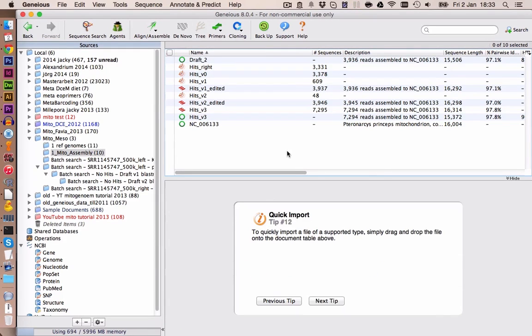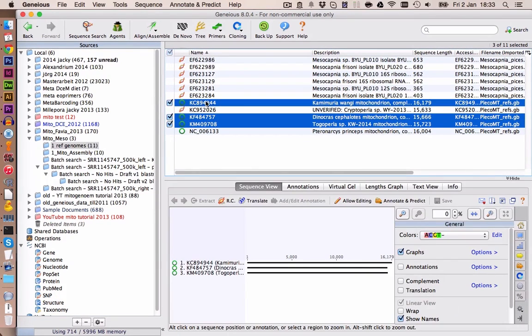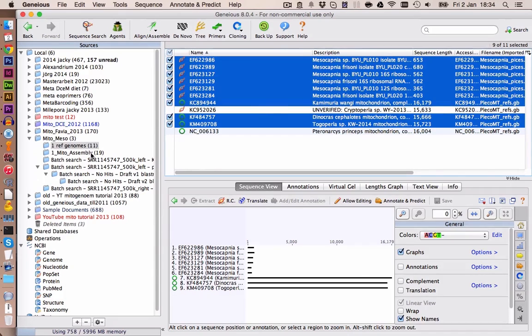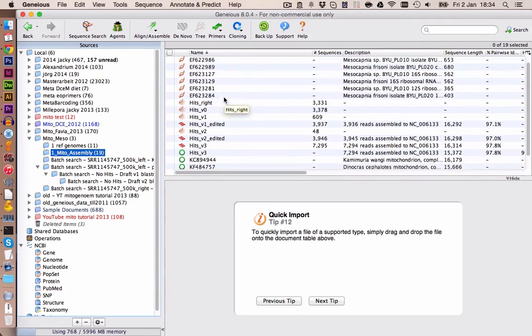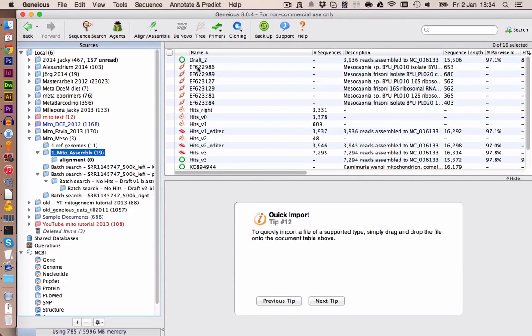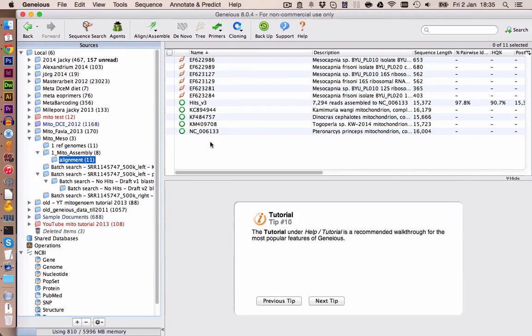So let's get some more reference genomes in here. And actually let's include also the Mesocapnia sequences. Let's maybe make a new folder. And we call it alignment, just to have things a bit more organized. This should be fine.